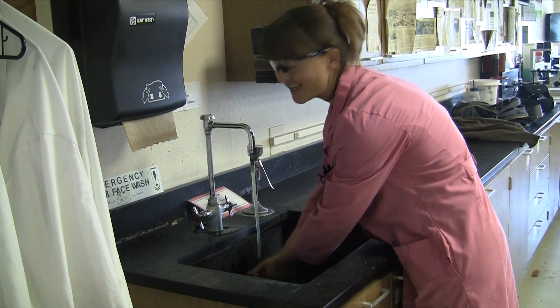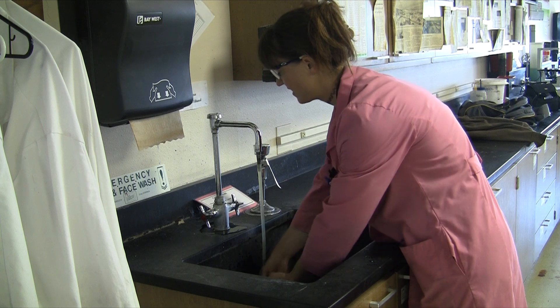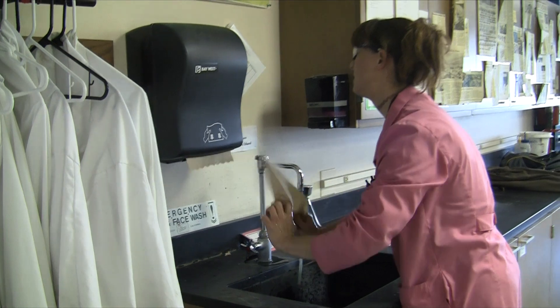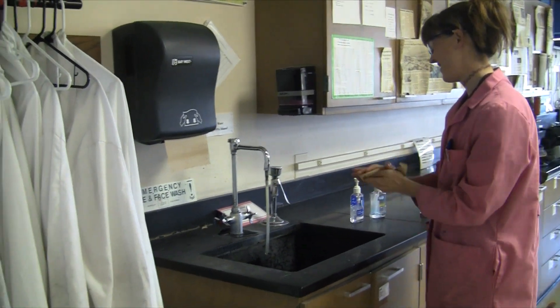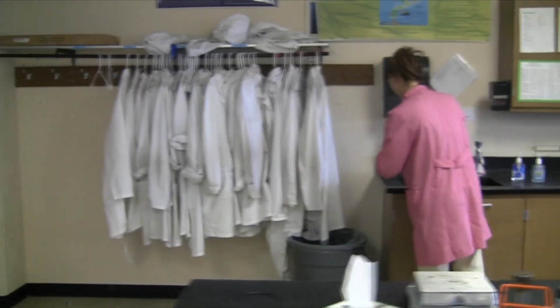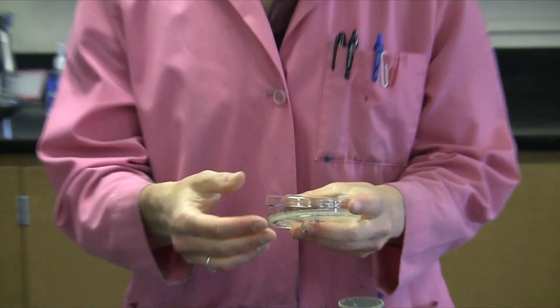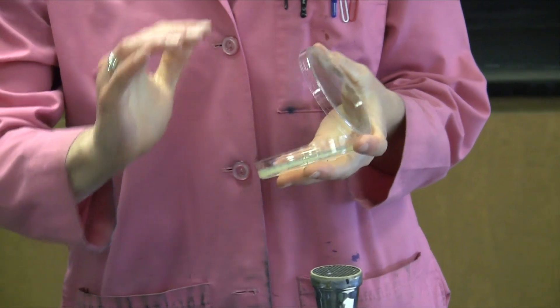Try not to touch anything after you've dried your hands, and go straight to your plate to do the treated side. Make your four-fingered impression on the treated side. If you were really careful, try not to even touch the plate before you make that impression.